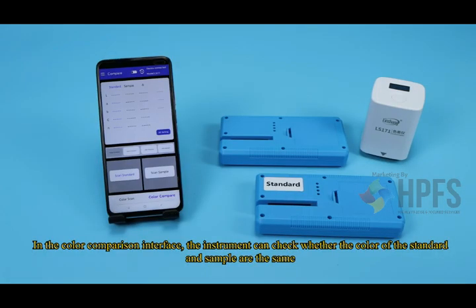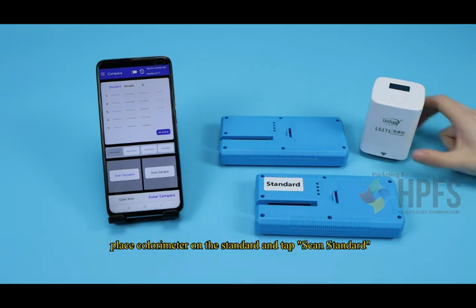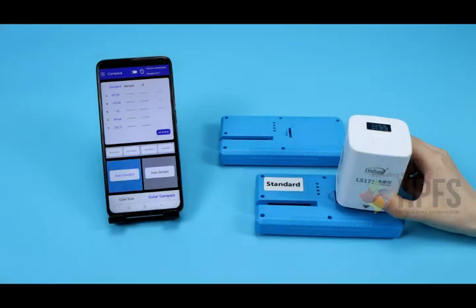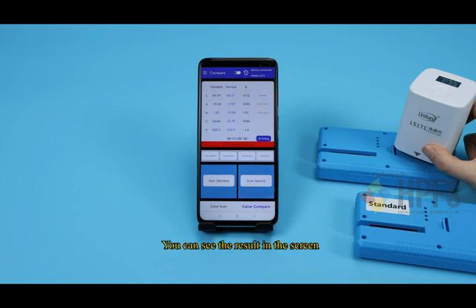In the color comparison interface, the instrument can check whether the color of the standard and sample are the same. This is a standard plastic shell and another is a sample. Place the colorimeter on the standard and tap Scan Standard. Then move to the sample and tap Scan Sample. You can see the result on the screen.